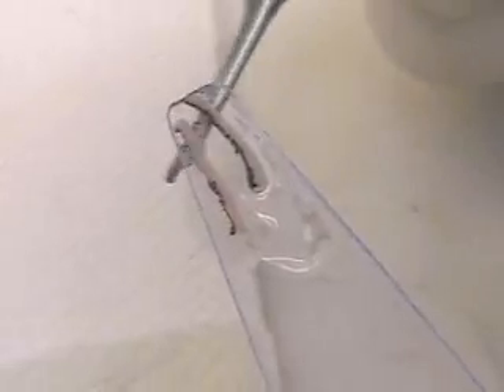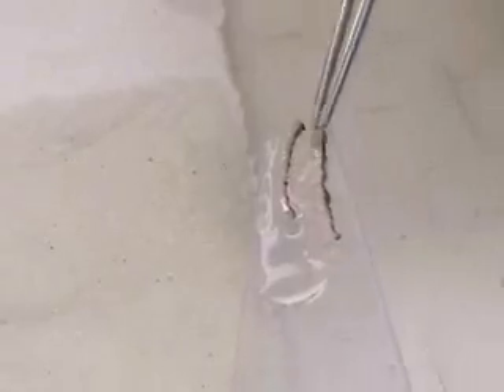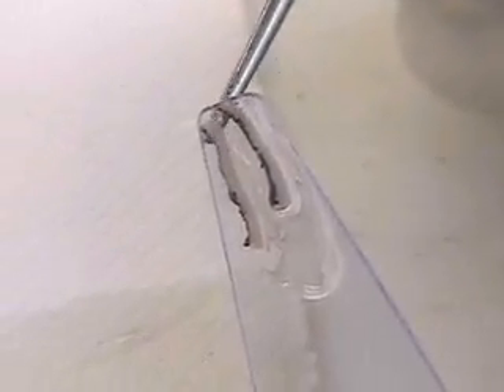Now I can look through the bottom of the dispensing slide to make sure that I can see my margin on all aspects of it, and I can line that up just precisely. I'm just able to see my ink and manipulate this rather flimsy portion of tissue so I can get my ink.